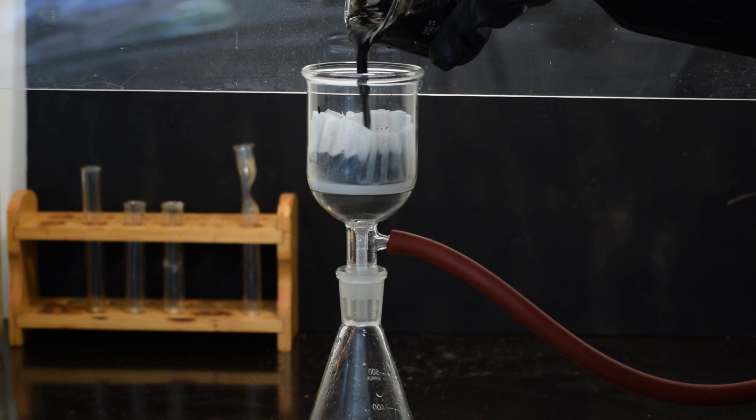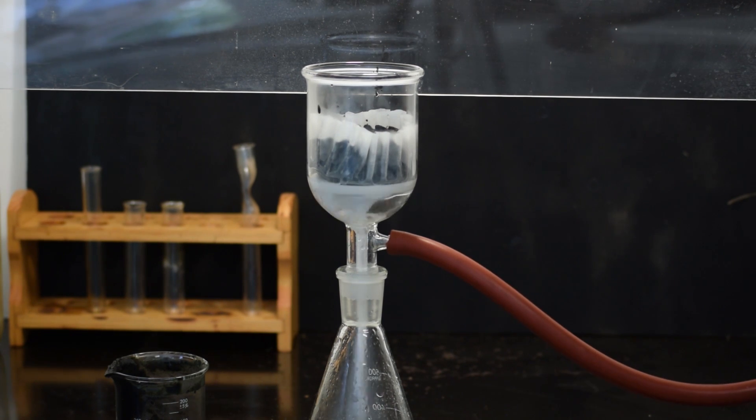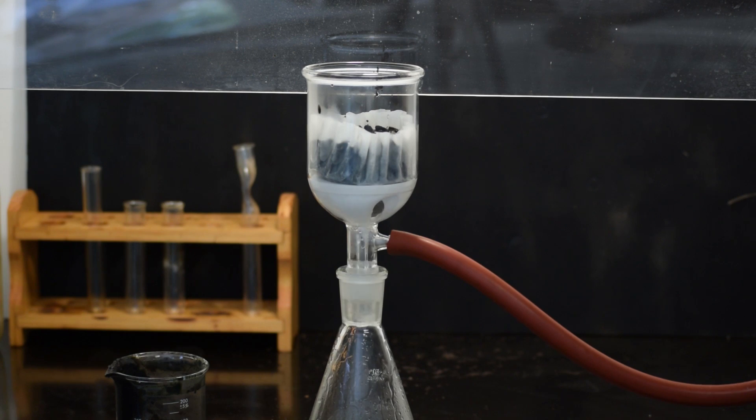It's a good idea to wash the copper oxide with some hot water to remove any soluble impurities. I recently got this vacuum filtration setup and I'm really liking it so far.